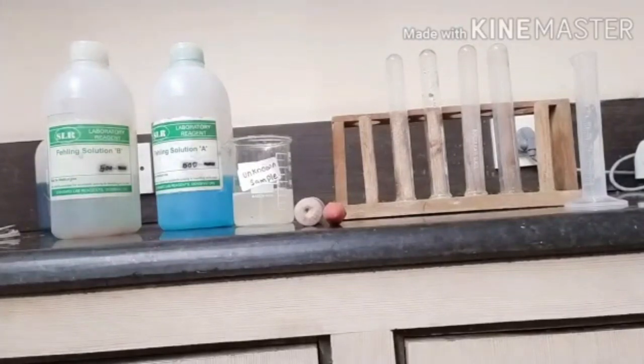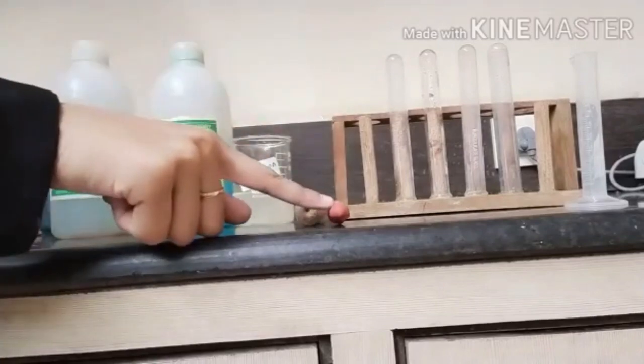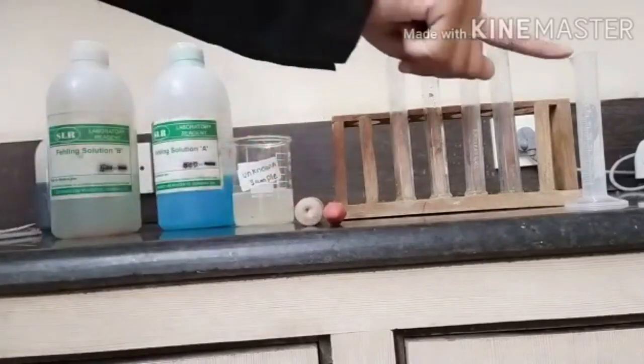The first test will conduct the test of carbohydrate. In this test, we require such apparatus like test tube, test tube stand, dropper, holder and measuring cylinder.